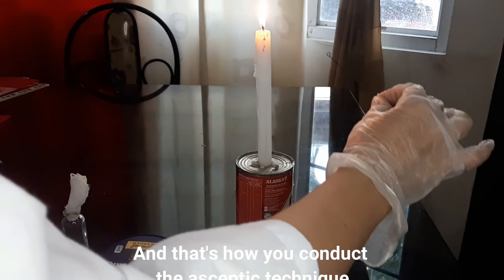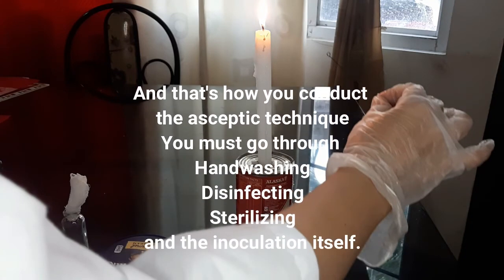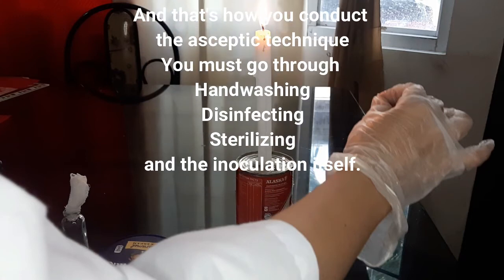And that's how you conduct the aseptic technique. You must go through hand washing, disinfecting, sterilizing, and the inoculation itself.